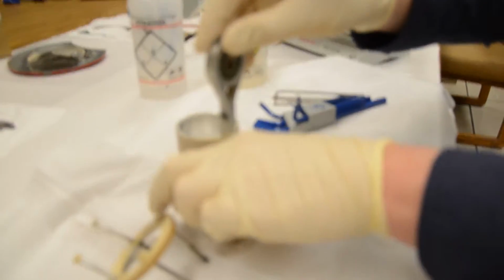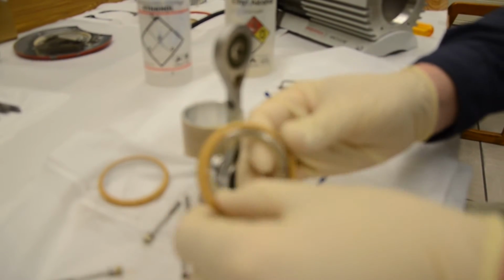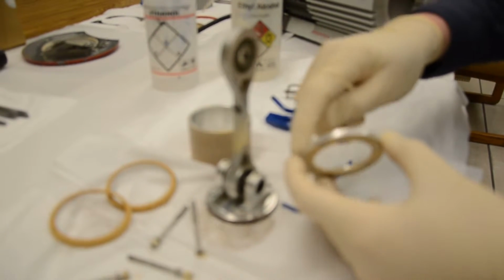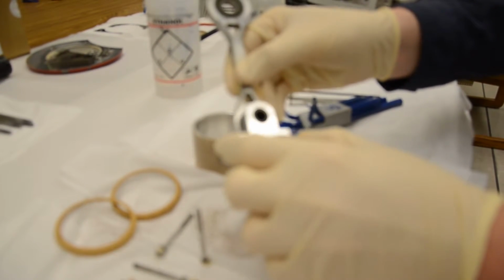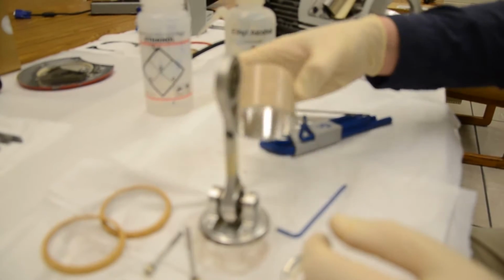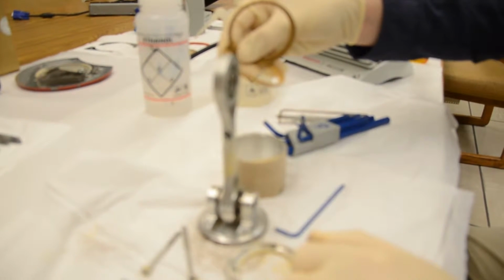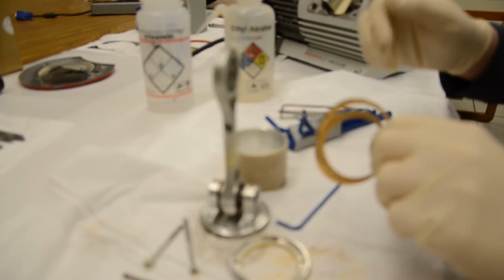Now this is actually a Teflon gasket of sorts. And we have another Teflon gasket right here. Now on a different version of this pump, there may actually be a black O-ring right in around here, and there would also be a black O-ring in and around here as well. So you can see how dusty it is. And we're going to now clean all of these pieces with alcohol. These Teflon gaskets are discarded and they will be replaced with new ones once the rest of this is clean.